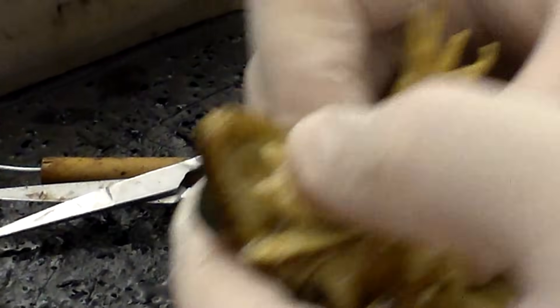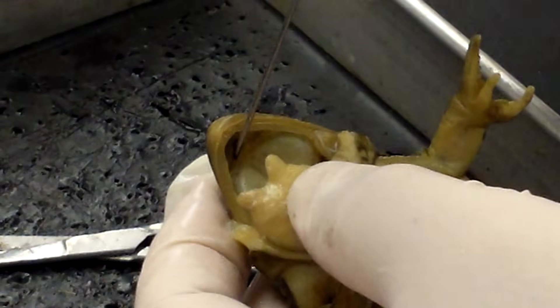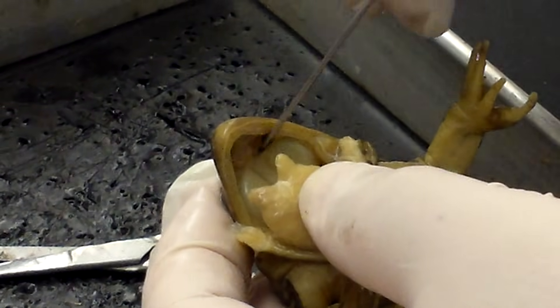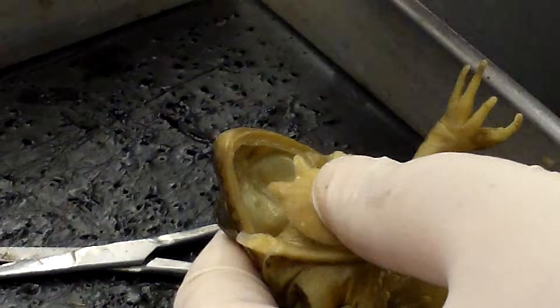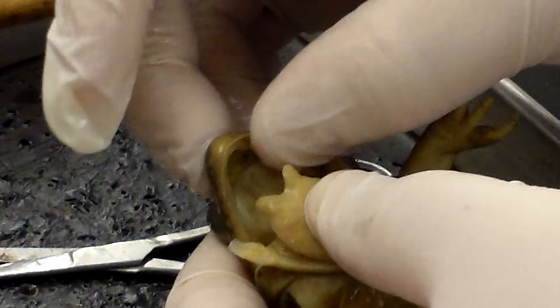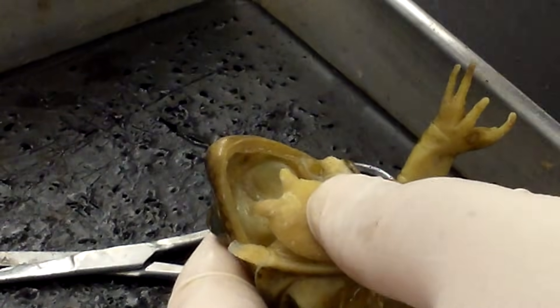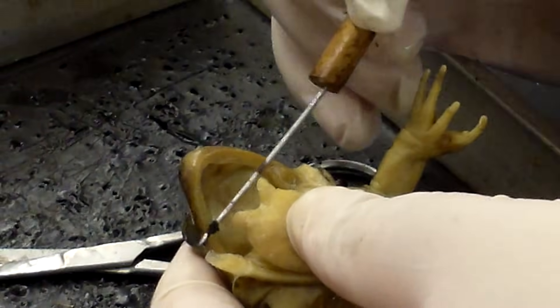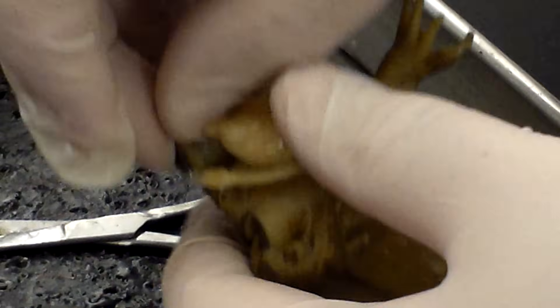If we look inside the roof of the mouth, you can see two openings — those are the internal nares, where the external nares, the nostrils, open up into the mouth. Frogs have two sets of teeth. They have outer teeth for grabbing insects and prey and holding on to them — those teeth are called the maxillary teeth. You can't really see them; you actually have to rub and feel. It's kind of bristly, almost like the setae on an earthworm.